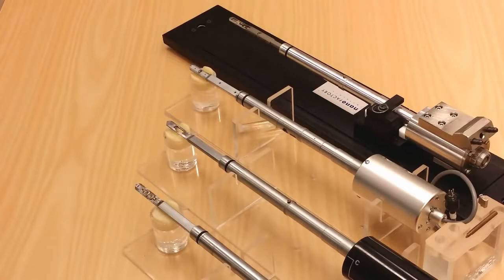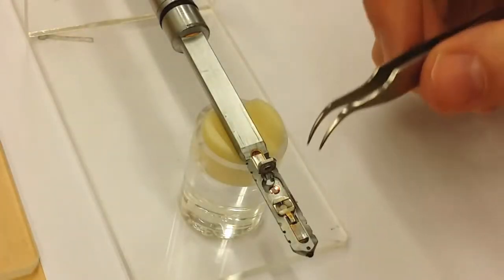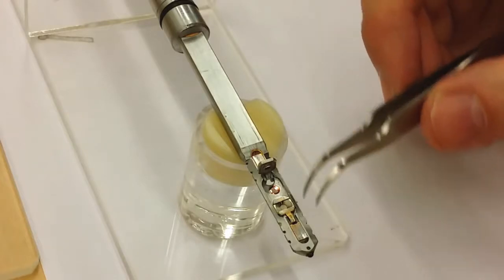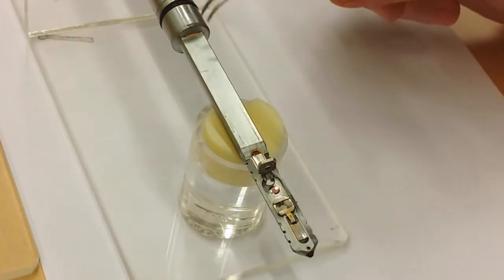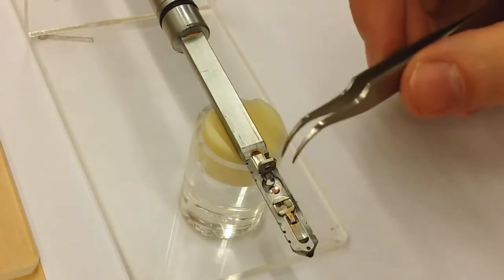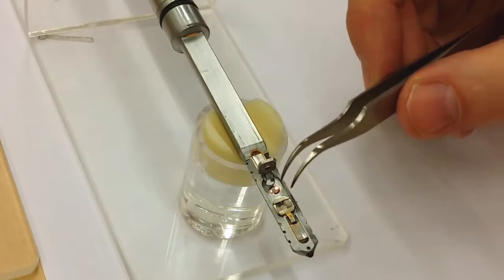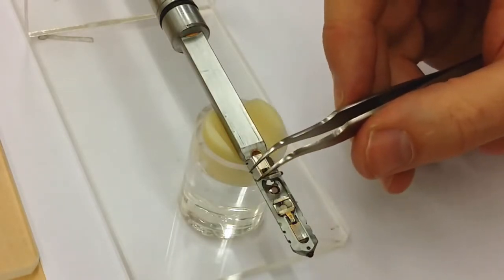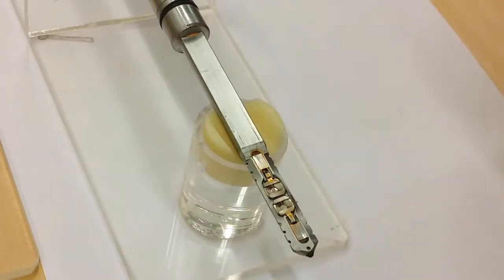To put the sample inside the TEM, you need a sample holder. Here you can see 4 of them. The first one is a very basic sample holder. Here in front is the piece that goes inside the vacuum. You can see the O-ring here that separates the atmospheric pressure from the vacuum. Inside here you can see there are 2 sample slots where you put in your samples. And you just clamp them with this little clamp, and that fixates the sample.